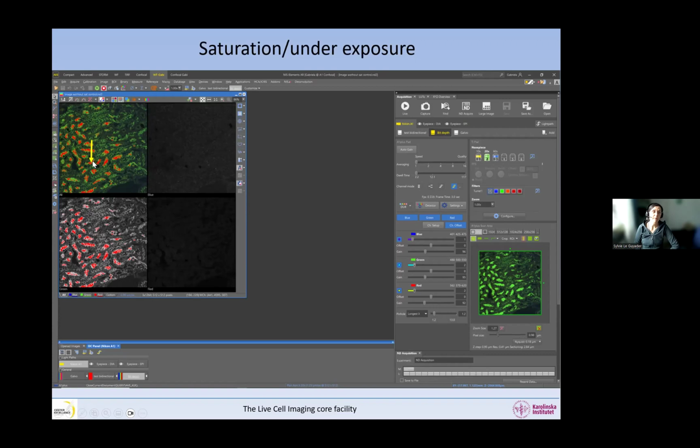Right now I have applied a mask that allows me to see the saturation, and it's color-coded in red. So everything that is red in this image is saturated. If I put my mouse above one of the places that are saturated, I can see something under the image, and this is something you can do in all software. If you move your mouse across the image, somewhere in the software you should be able to see the XY position of your mouse, the intensity at that point, and the intensity of each channel. In this case we have 3 channels, so this is the XY position, and these are the 3 intensities coming from the 3 different channels. What we can see is that the green channel, at the place where I have my mouse, has an intensity of 4095, which is a number that maybe some of you may recognize.